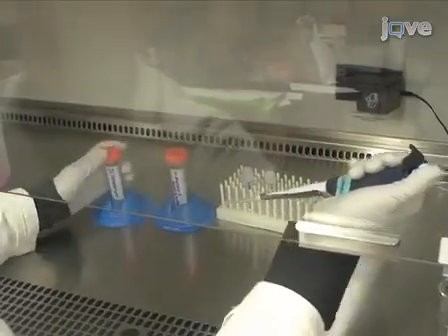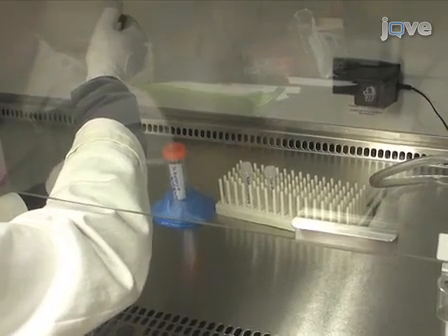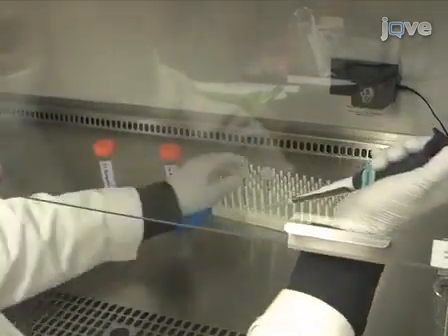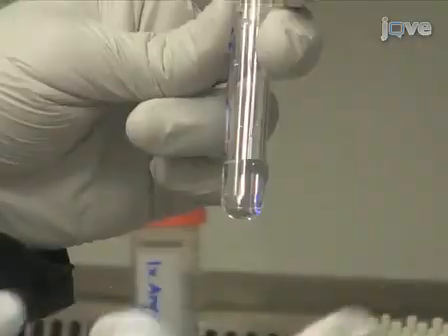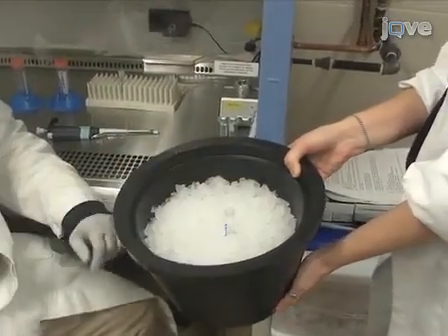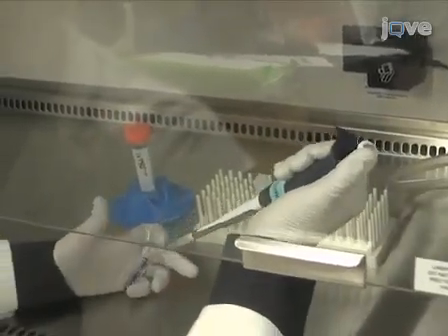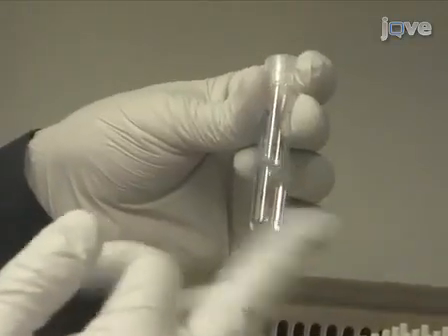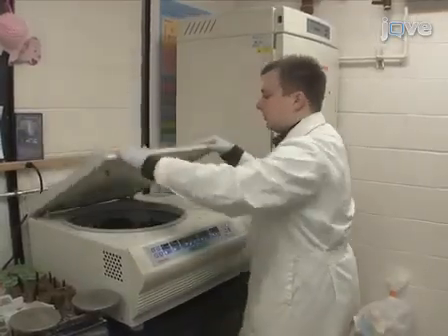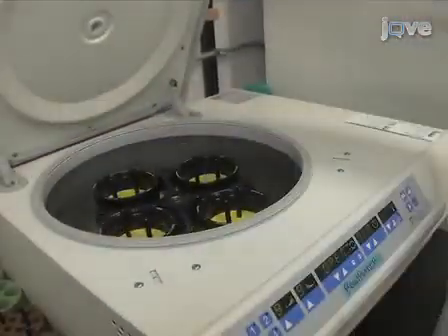Resuspend the cells in another 500 microliters of 1x Annexin V binding buffer with 500 microliters of 2% formaldehyde to create a 1% formaldehyde solution. Mix the tubes by gentle flicking. Fix the samples on ice for 10 minutes. After fixing, add 1 milliliter of 1x PBS to each sample and mix gently by flicking. Centrifuge the cells at 425 g for 8 minutes at 4 degrees Celsius 3 times.